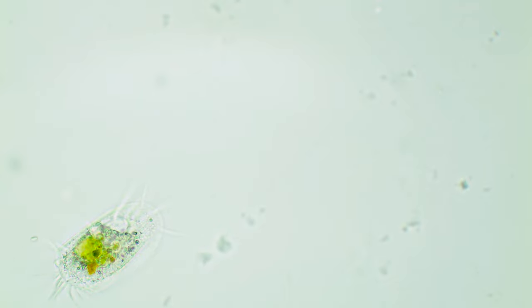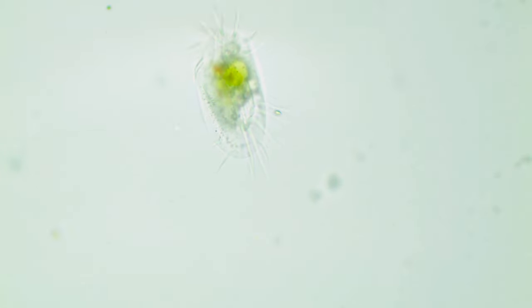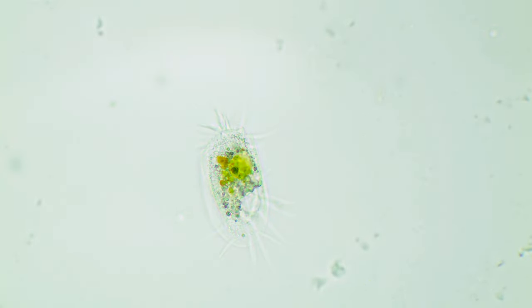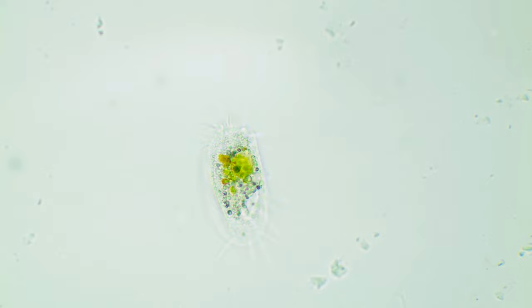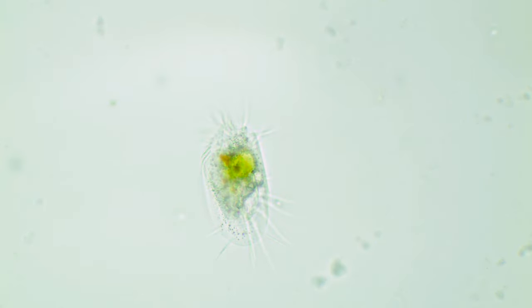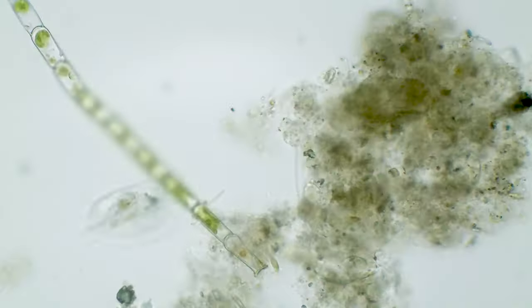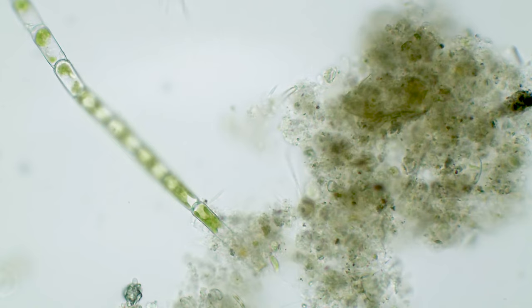I also found some really interesting ciliates, which are microorganisms that use little hairs called cilia to paddle through water. They need them because at their size water acts like really thick syrup, and conventional swimming just doesn't work. The one we are looking at right now is a member of the Euplotes genus — by refocusing a bit we can resolve all of its micro organs. It looks like a micro robotic vacuum which drank too much coffee — and guess what, it's transparent again.